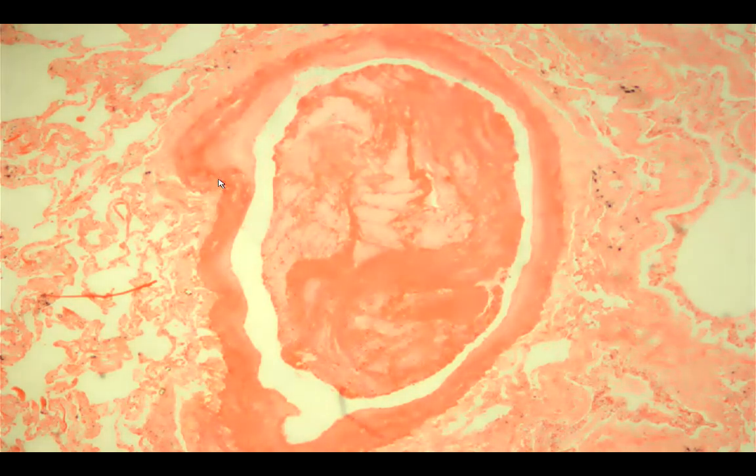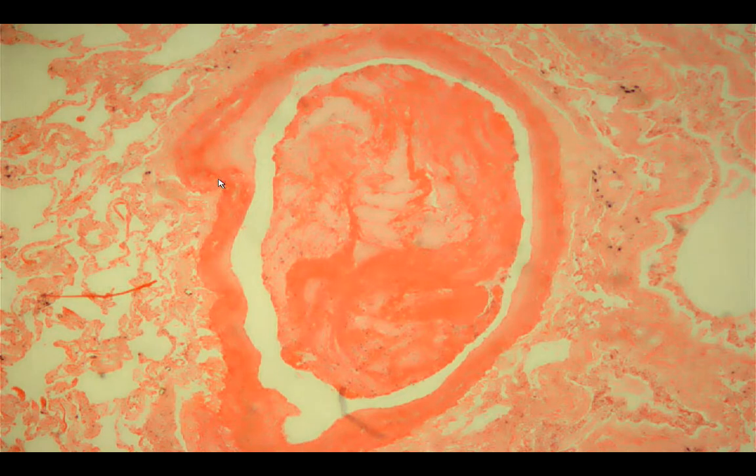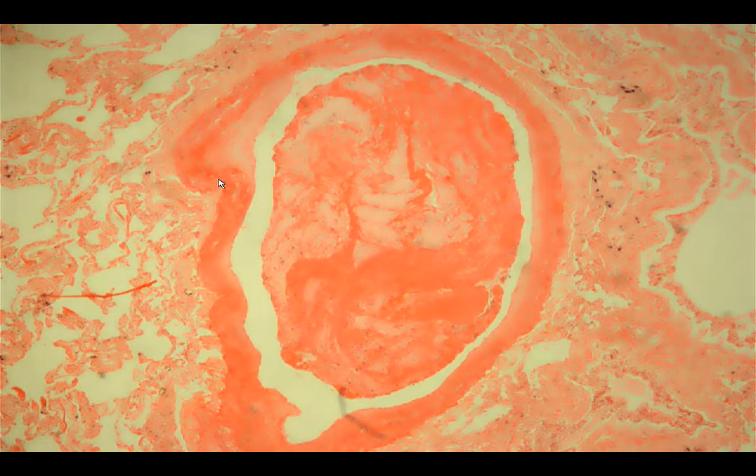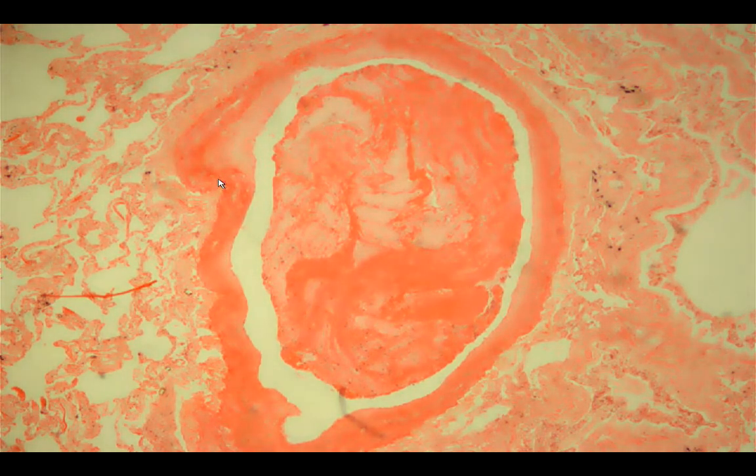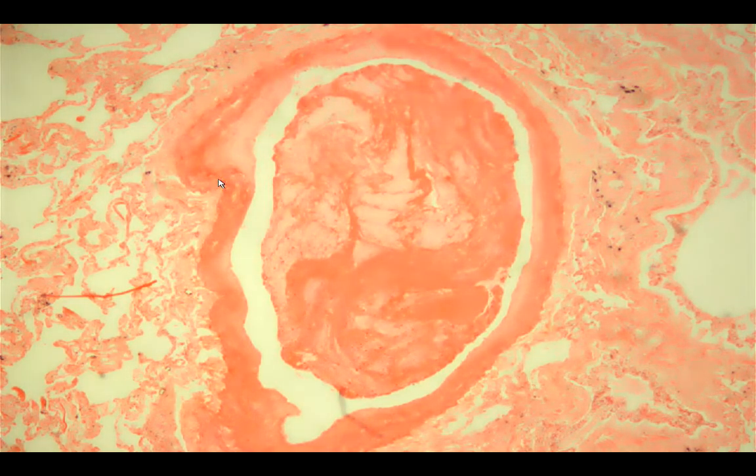We are going to look for a vessel wall that is occluded. Here is the vessel wall that is occluded. An embolus refers to a detached intravascular mass — it can be solid like this one, liquid, or gaseous — that is carried by the blood from its point of origin to a distant site. For pulmonary embolism, the most common origin of an embolus to the lung is from the deep veins of the leg, so we call that DVT or deep vein thrombosis.